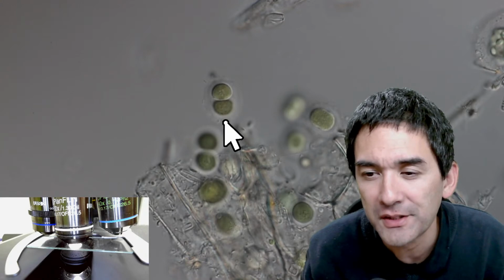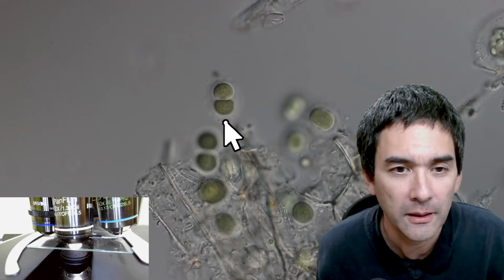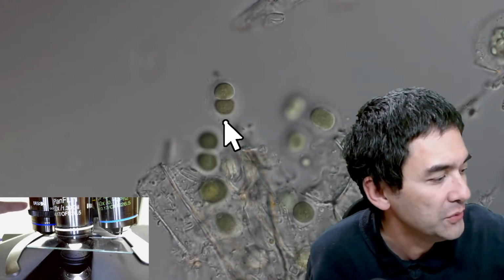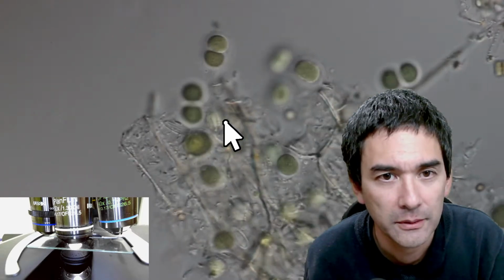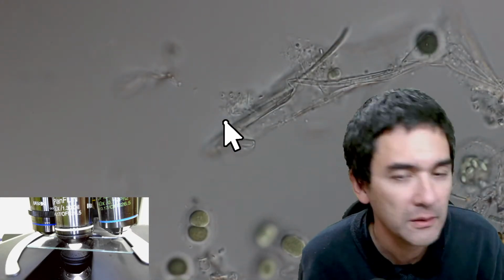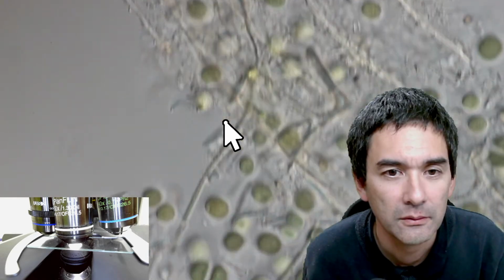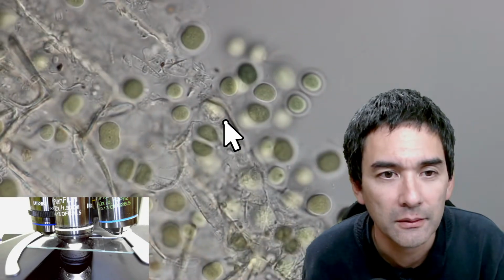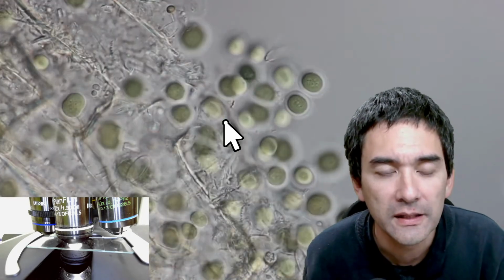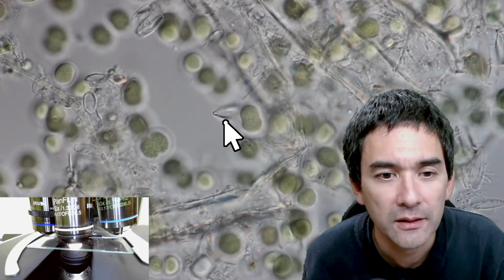Yeah, you're right about the bubbles. Bubbles can ruin the image. It's possible that sometimes there are bubbles in the oil. Okay, and in this case, what you do is you can actually go a little bit like this to remove the bubbles. Okay, so let me go up a little bit more with the light again. I've seen already more interesting specimens, but yeah, so that is basically some diatom shells.